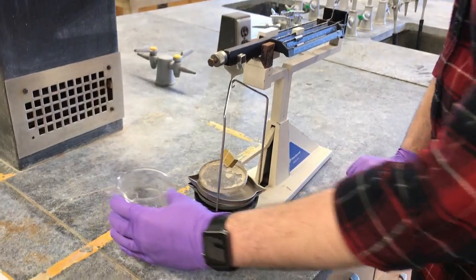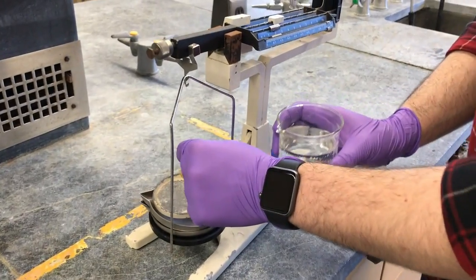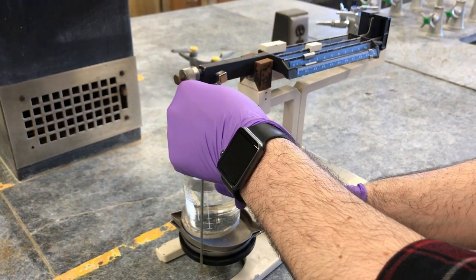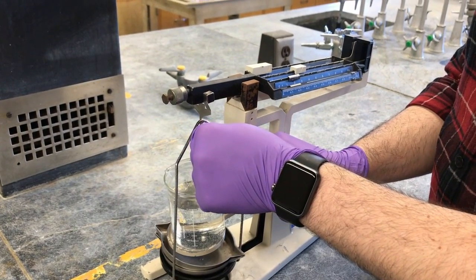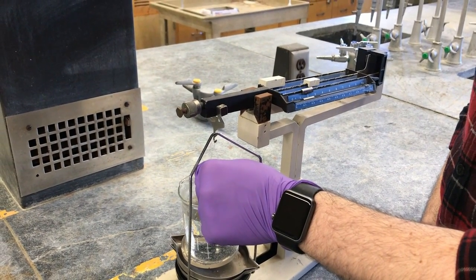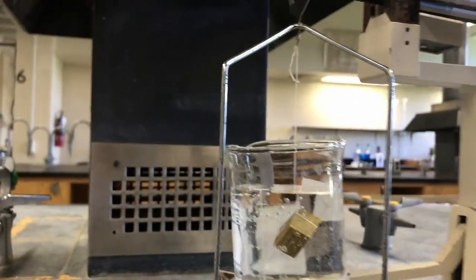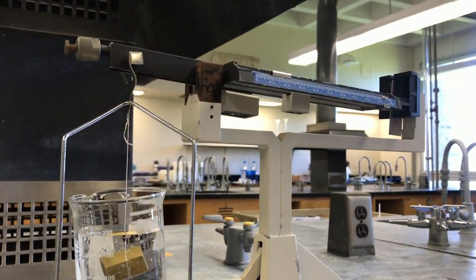So now for the next step of method 3, Archimedes method, we're going to carefully and gently lift up this solid, carefully placing our beaker of water here. So it's on this stand so that this mass can still move around. We're not recording the mass of the beaker. We're going to gently lower the mass into the beaker of water, and you'll notice that it's not touching the bottom and it's fully submerged. How frustrating would it be if it slipped off the string right now? So we have to be careful.